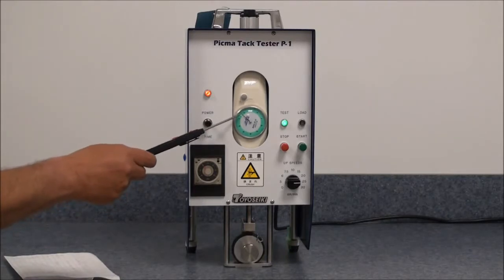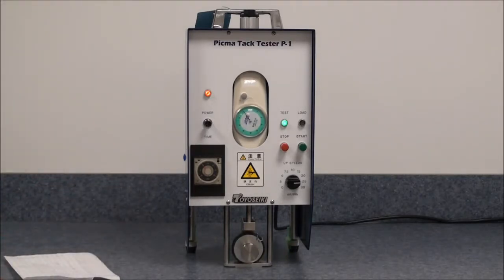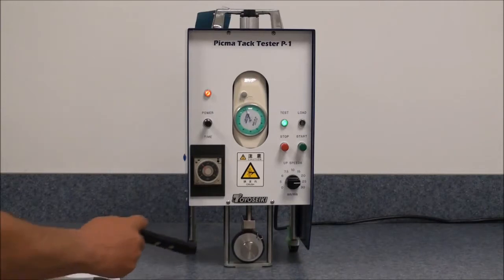As we can see here, the force is growing until the sample is released from the material.